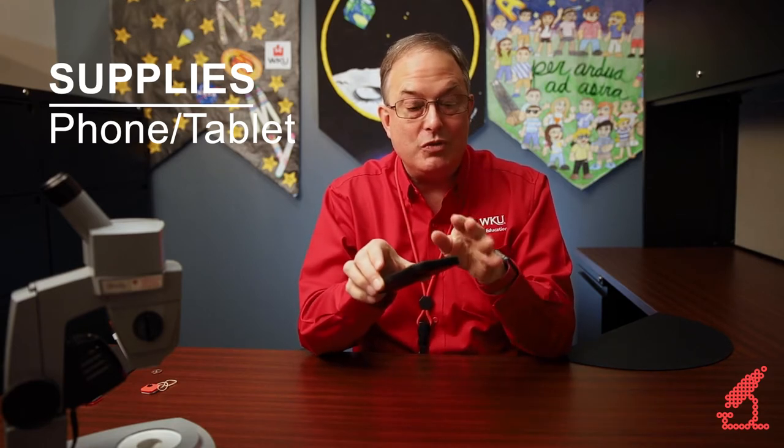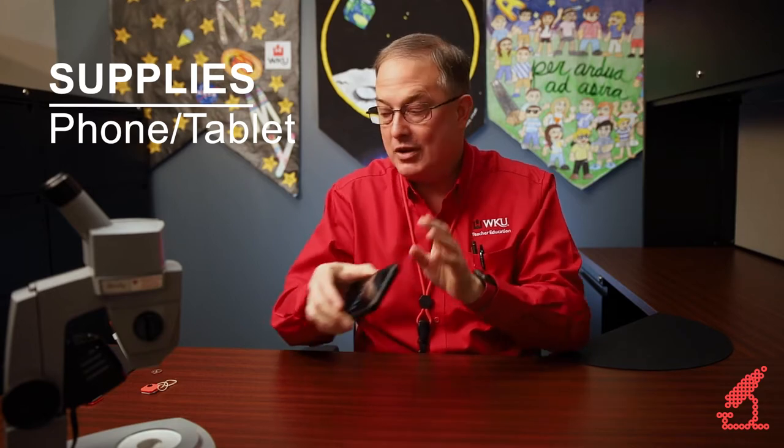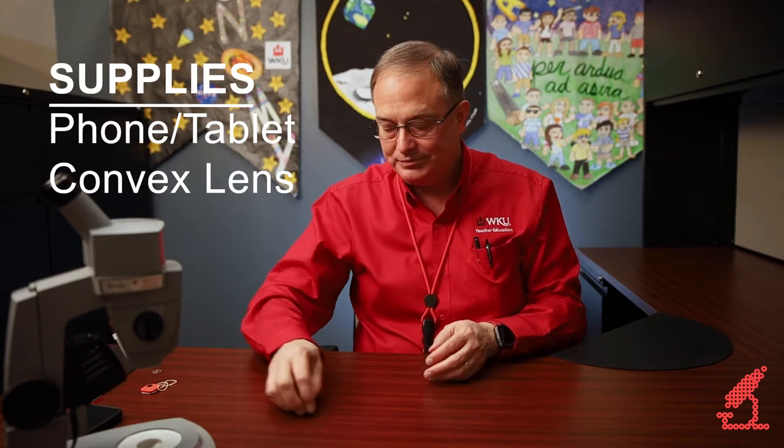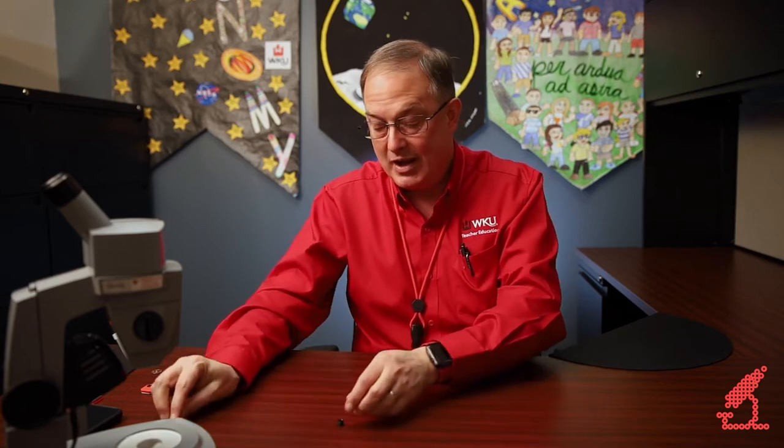To do this requires a smartphone — it can be an Android phone, an iPhone, or even a tablet — and you use this with the tablet or phone to make the microscope do what it's going to do. The next thing you're going to need is a convex lens. You need a convex lens that has a focal length of anywhere between about 5 and 25 millimeters. This is actually a convex lens out of a laser pointer — literally a $2 or $3 cat toy kind of laser pointer.